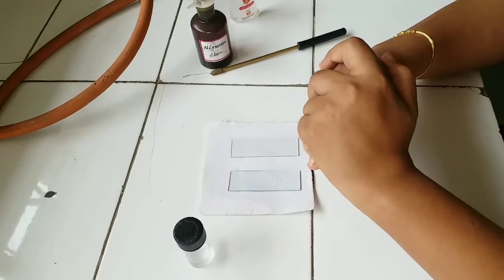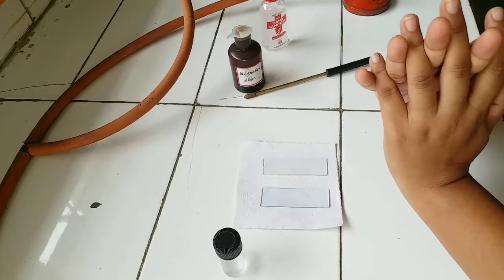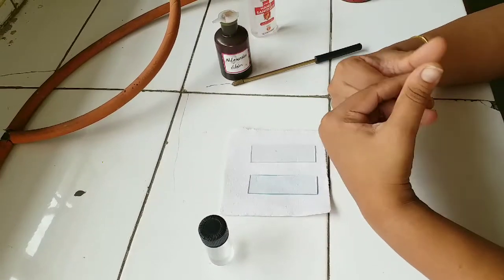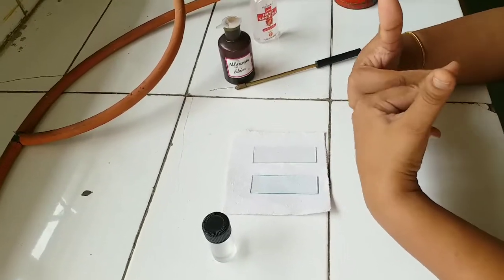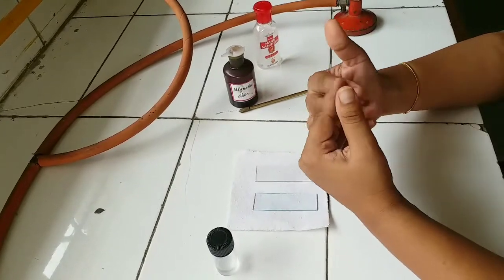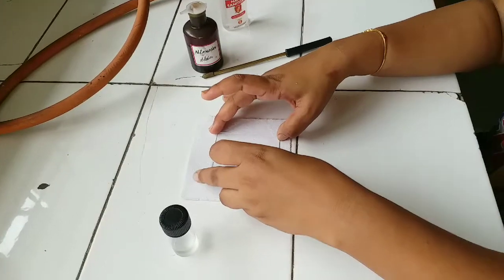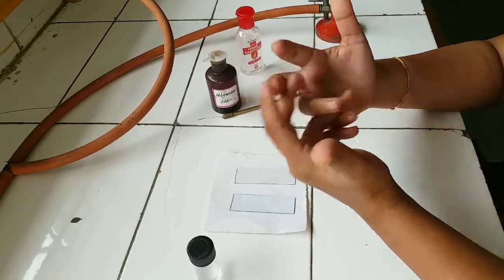Now, what is the principle of negative staining? The acidic dye contains a negative charge, and the bacterial cell also contains a negative charge. So what happens is the bacteria will not gain the dye — the dye will not stain the bacteria. The dye does not penetrate because of the negative-negative charge repulsion. So the background will be stained dark, and the bacteria will appear colorless or transparent.